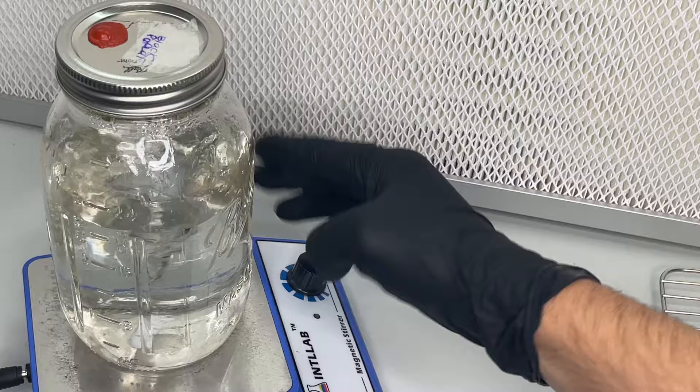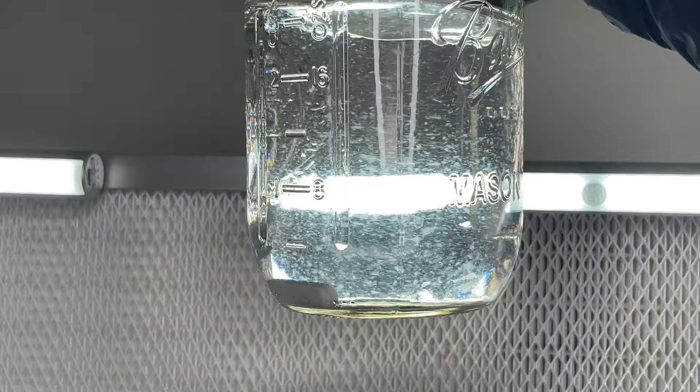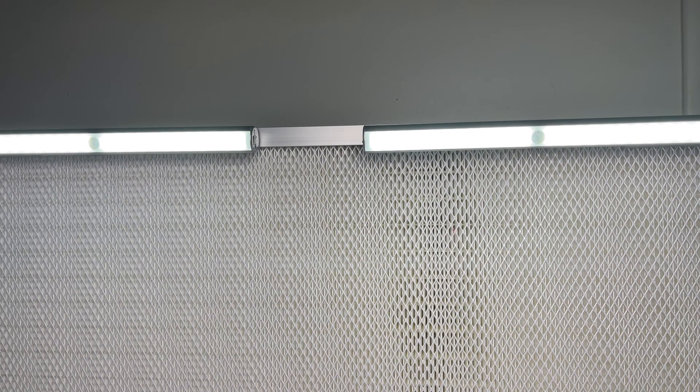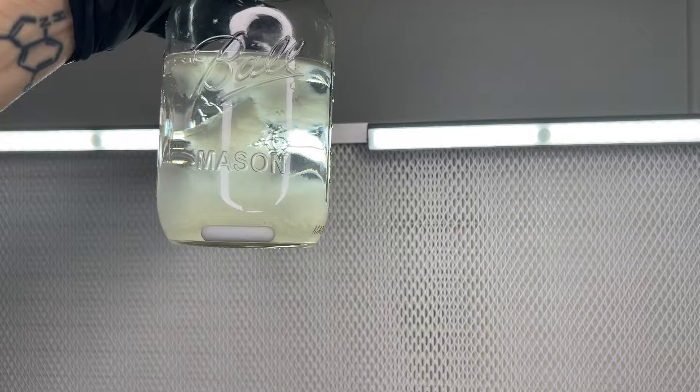After one week, you should have a clear view of the mycelium growing in the jar. I really can't get over how cool the mycelium looks right before stirring it a second time.